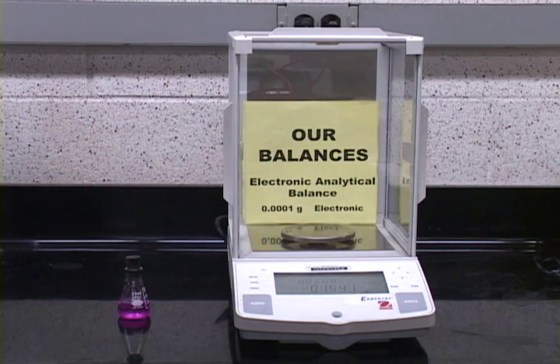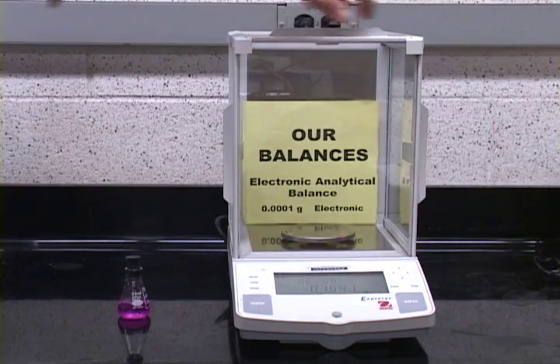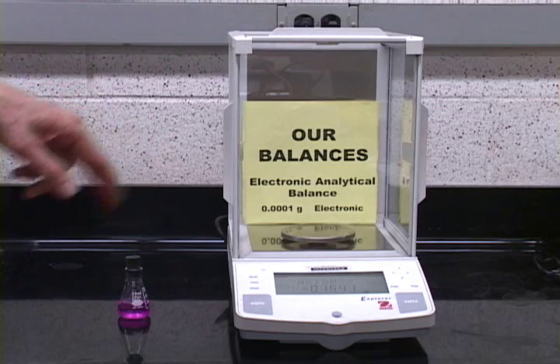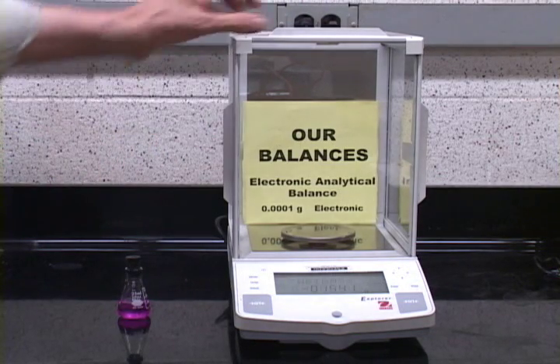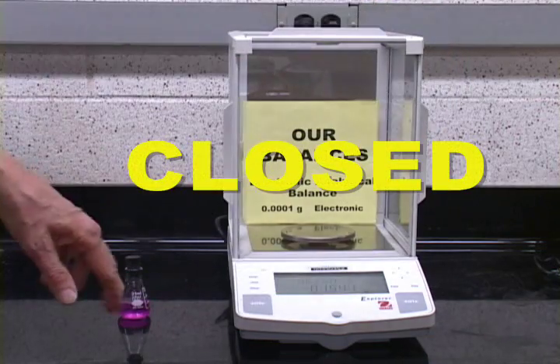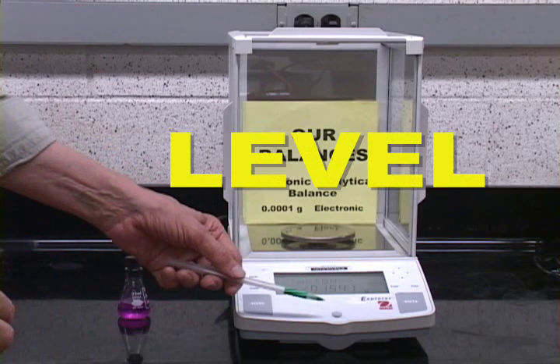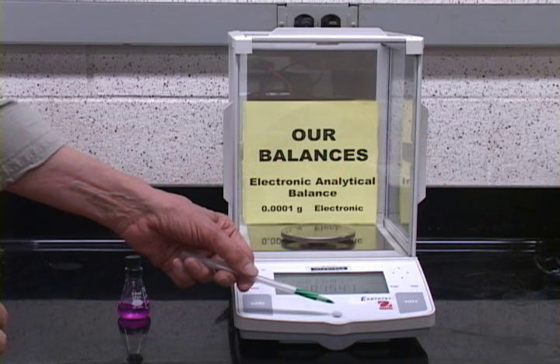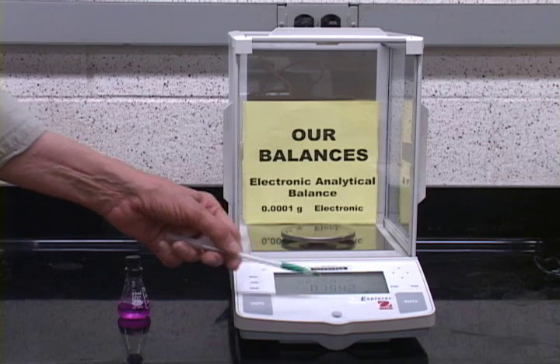Now to use this balance, notice it's enclosed in glass here. That's because it is so sensitive that air currents will affect its reading. So make sure that this balance is closed. Then make sure that the balance is level. You've got the level here, it's a bullseye with the air bubble right in the middle of the bullseye.